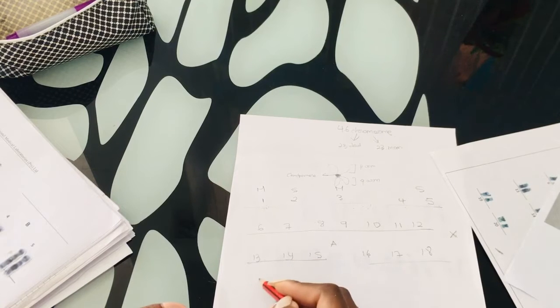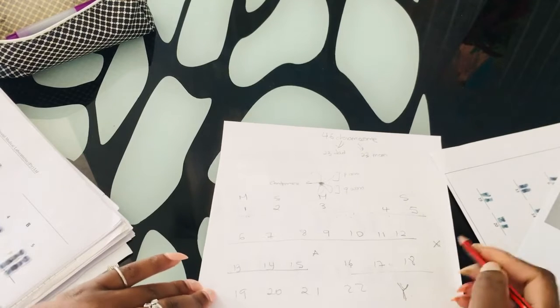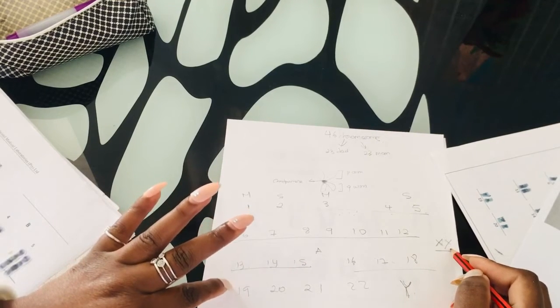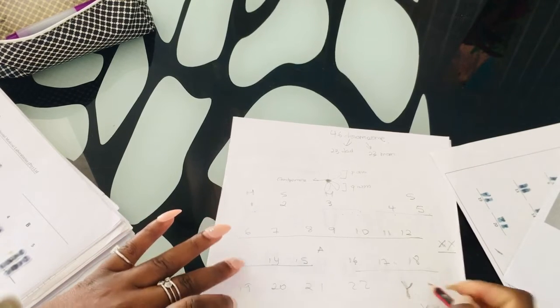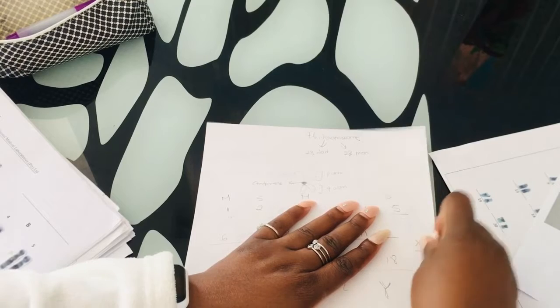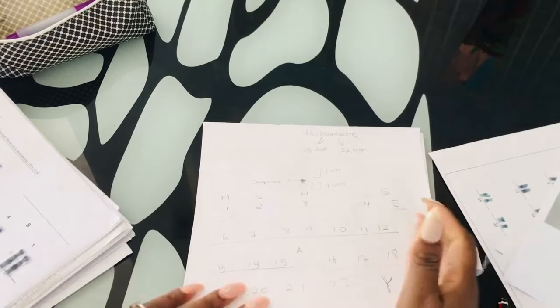And then we have our chromosome 19, 20, 21, 22, as well as our Y chromosome if we're dealing with a male. If we're dealing with a normal female, we're just going to have 2 X's. If we're dealing with a normal male, we're going to have 1 X, 1 Y. If we're dealing with any sex chromosome related abnormality, then that's when we see all those extra X or extra Y. But that's a topic of another day.